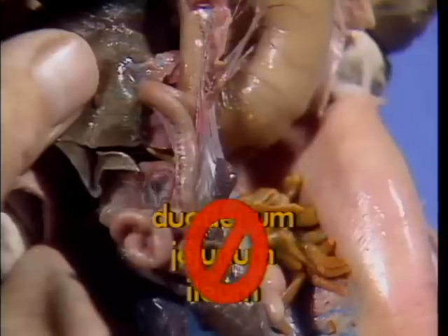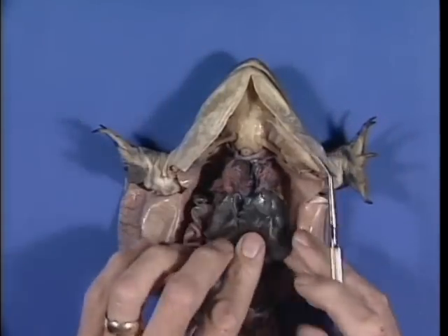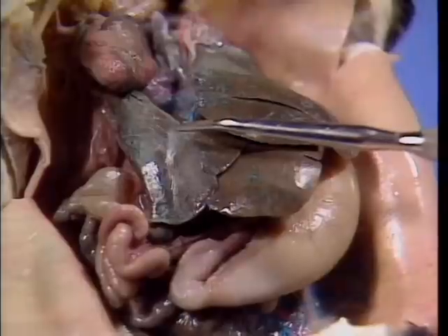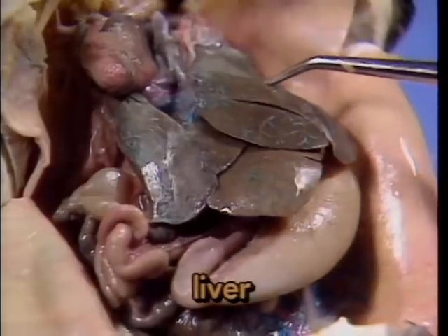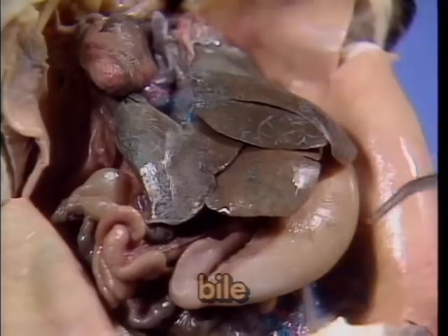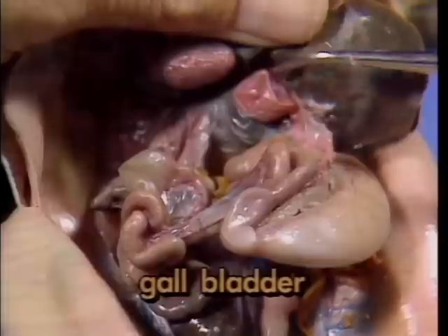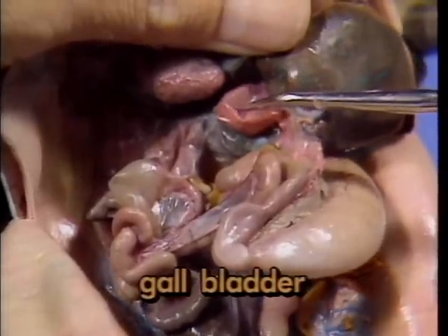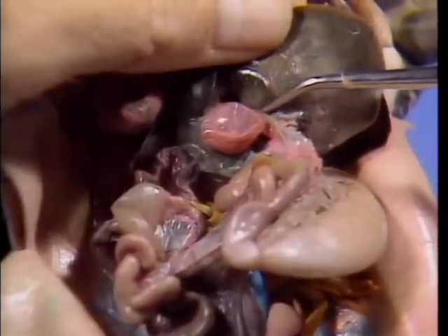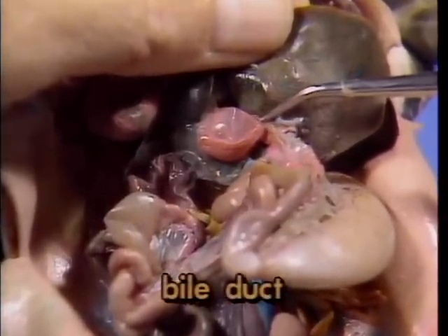This distinction cannot be made in frogs. 3 organs in this region provide digestive enzymes to aid in the breakdown of food. The large 3-lobed liver produces bile, which speeds up the rate of digestion of fats. Although bile is manufactured in the liver, it is stored temporarily in the gallbladder, here, beneath the liver. When needed, bile is carried into the small intestine through a tube, known as the bile duct.